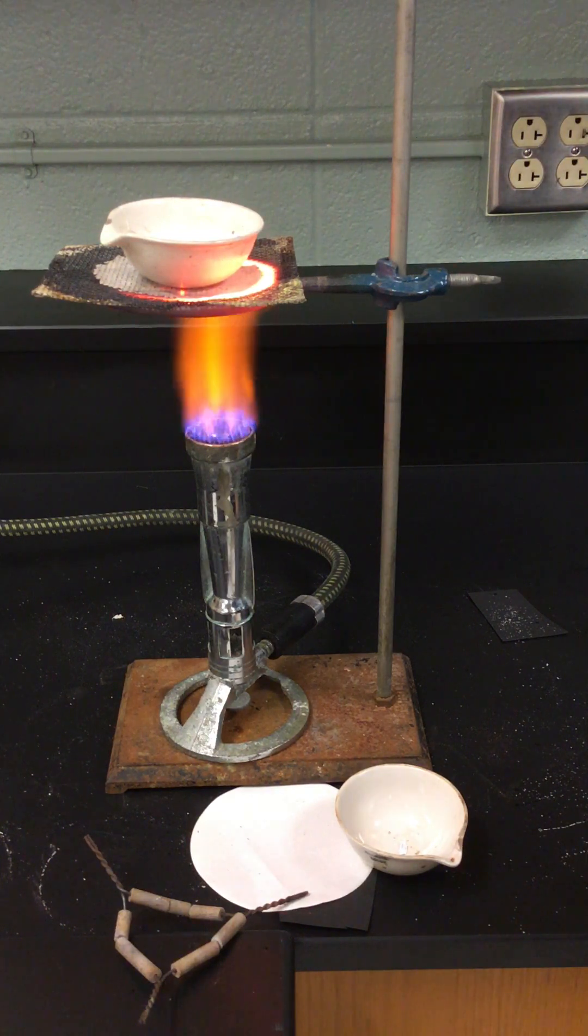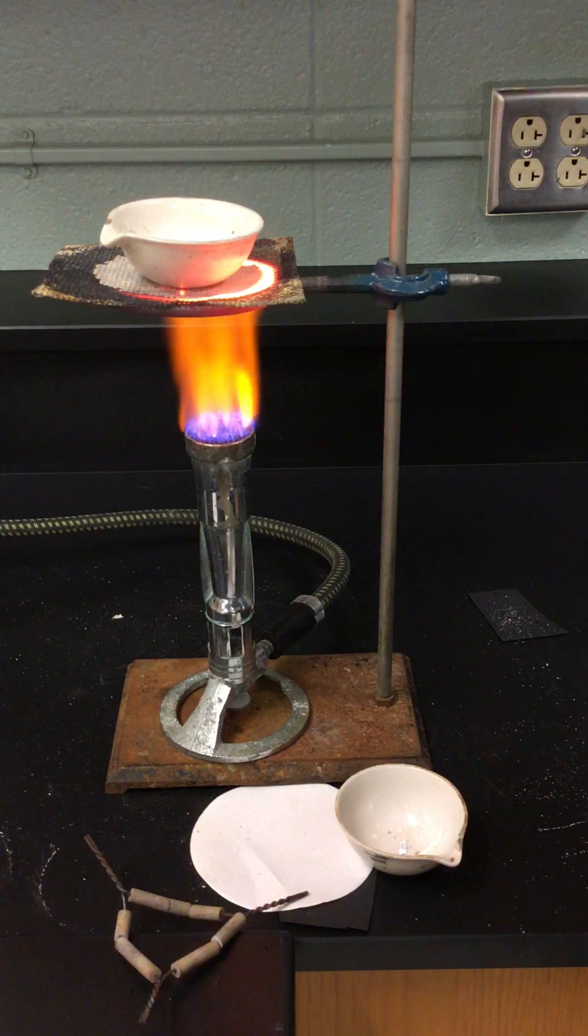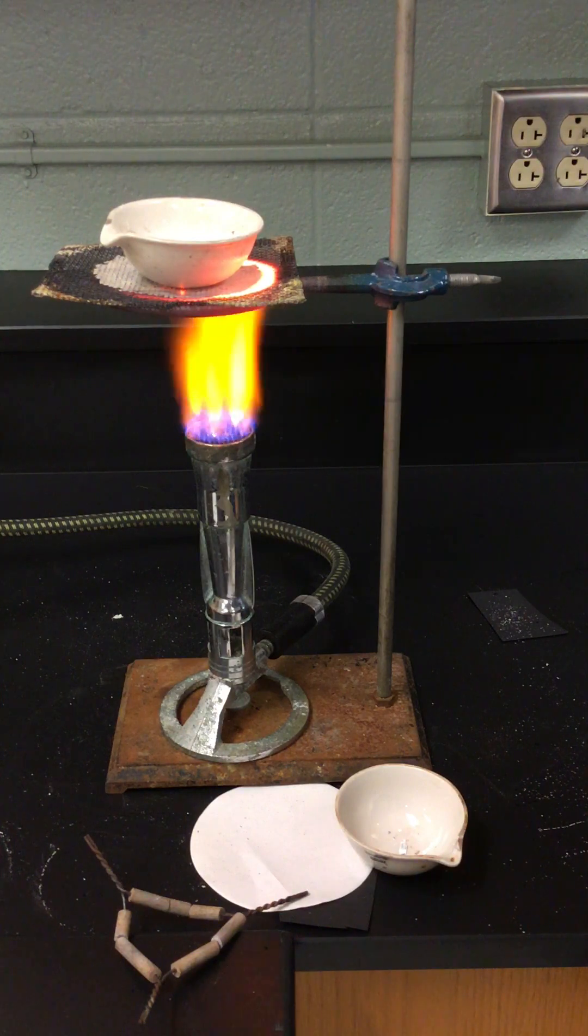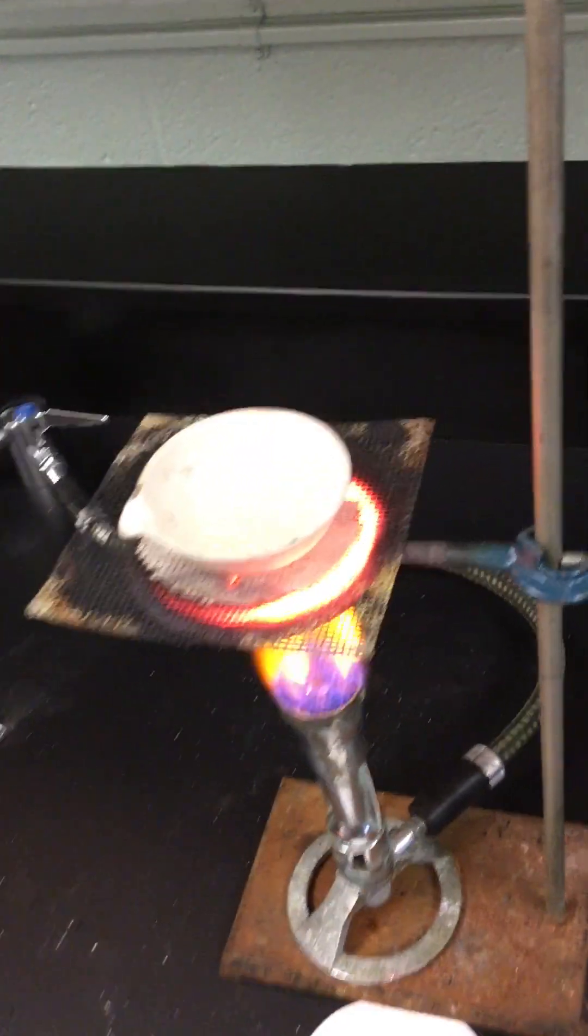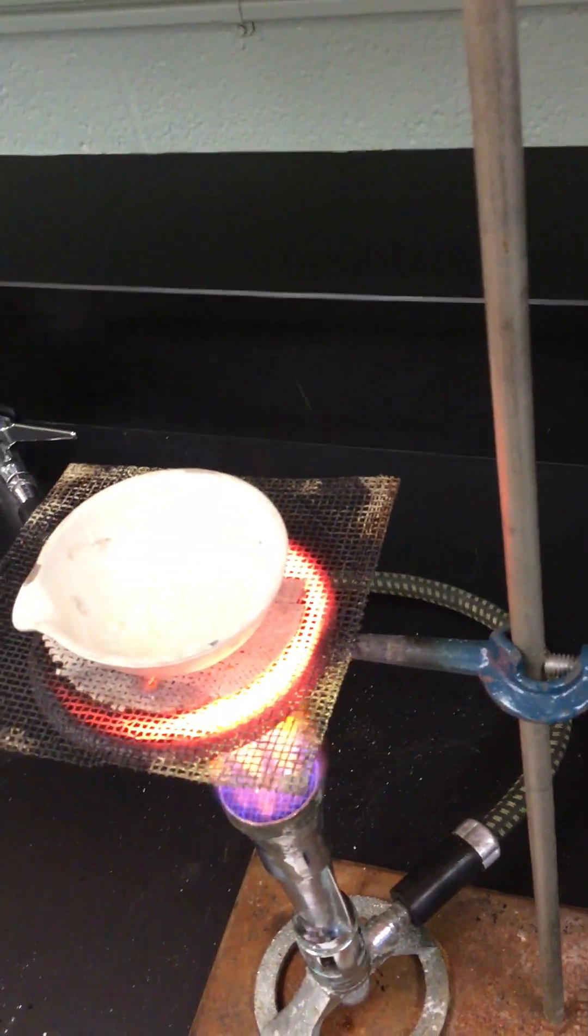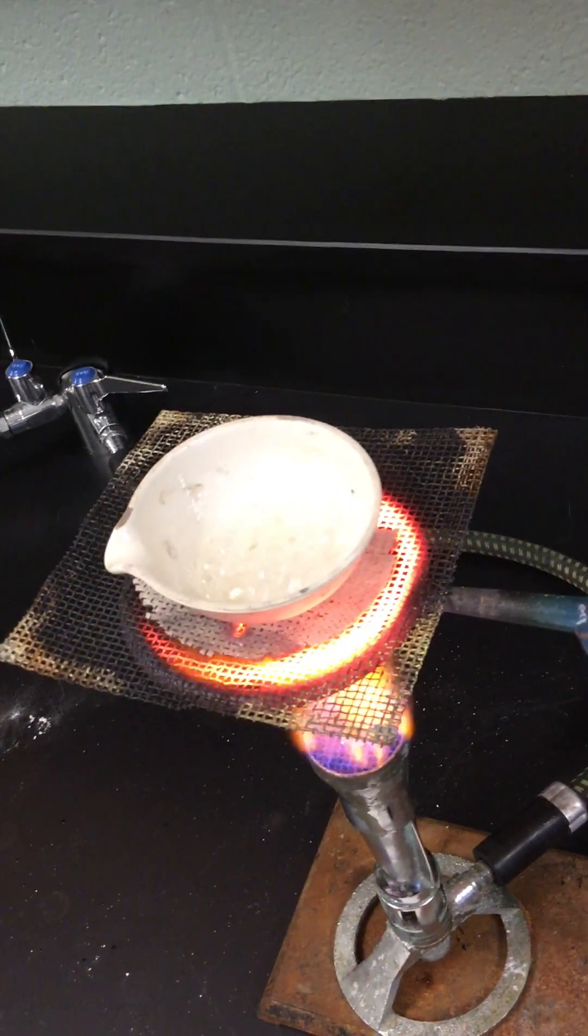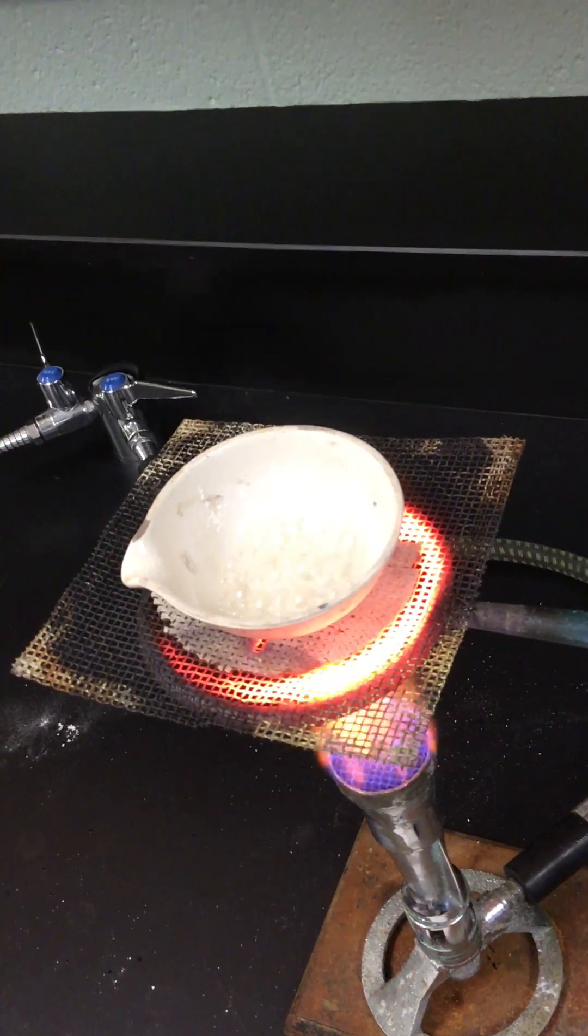Okay we're getting close now. I would say this is gonna take about another 90 seconds. I'm gonna see if I can get here a little bit. You can see it boiling a little bit there.